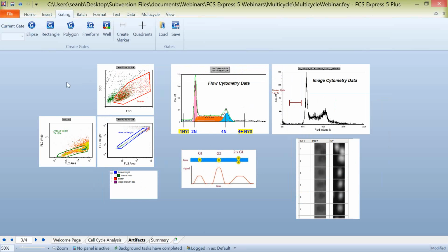You can see here with this particular experiment, we've done a few things. We've acquired our side scatter versus forward scatter parameter. We've also acquired our FL2, which is our DNA cell cycle parameter, width and area parameters, as well as our height and area parameters. By using a combination of these gates, you can see with our data analysis that we have this 4n plus situation, as well as some things going on down here lower than 2n. When we apply our scatter gate to that multi-cycle plot, this starts getting cleaned up a little bit. We're losing some of that 4n plus population up here, as well as cleaning up some of the things around the debris area, or things that are less than 2n.